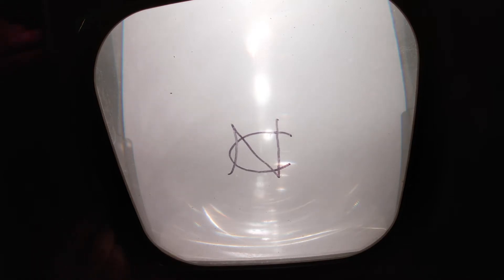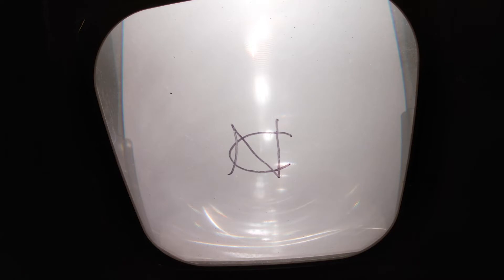Welcome back. We are going to be doing polarization light microscopy today. This is not our typical setup because I'd like to do a small demonstration before we get started. This is a projector taken from the biology building, hooked up to display an image on a lenticular screen — not a normal screen. It is coated in a very fine layer of metal, which preserves polarization as light bounces off of it.